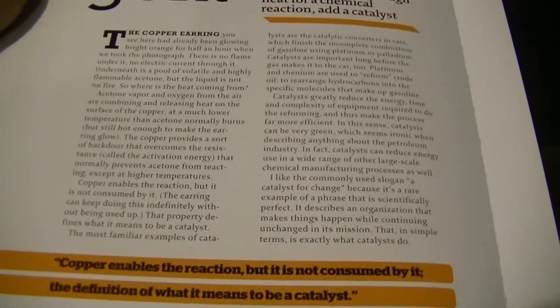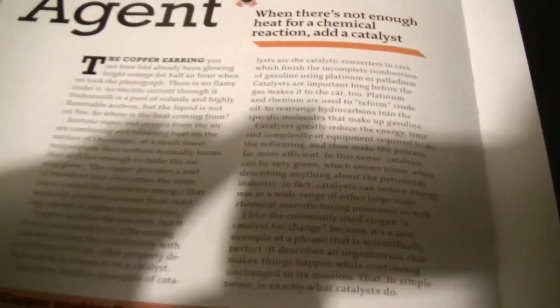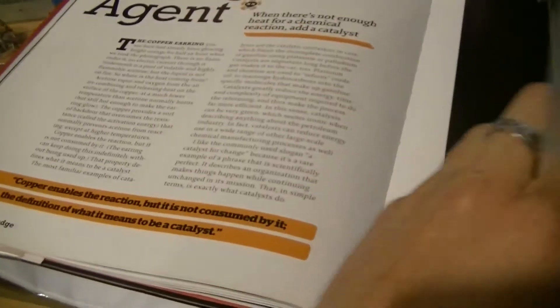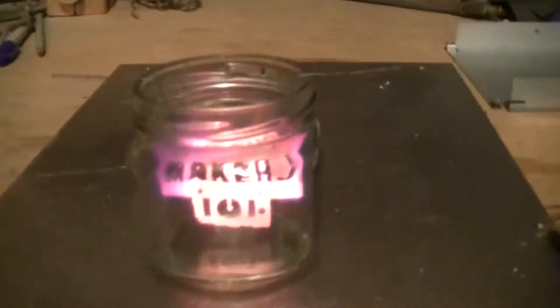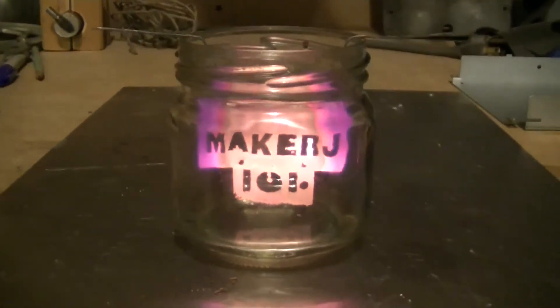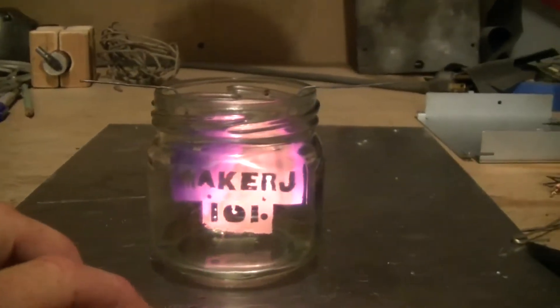Basically, if you want to read this, you can. If you want to pause the video, I don't know if it's high enough quality or not. He basically just has a piece of copper, heats it up with a blowtorch, and then after it's glowing you lower it into the jar of acetone and it just glows there. It'll pretty much glow infinitely or until the acetone runs out.